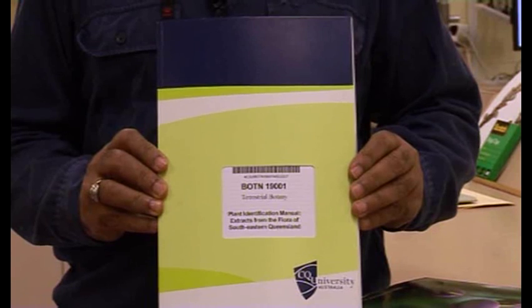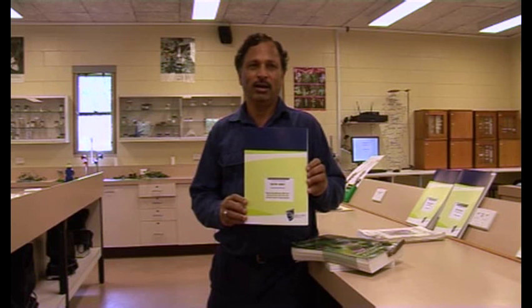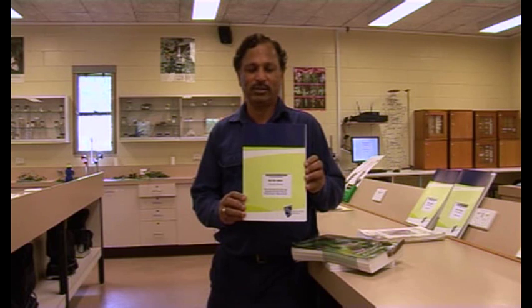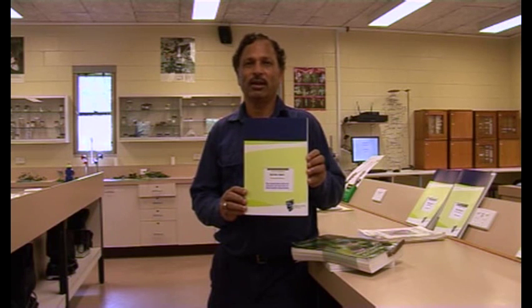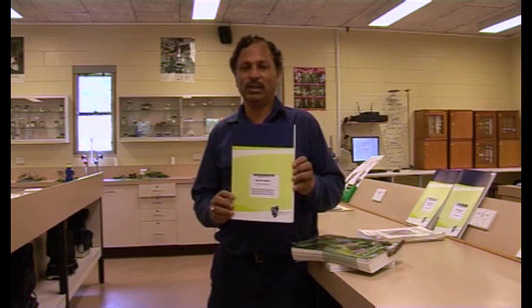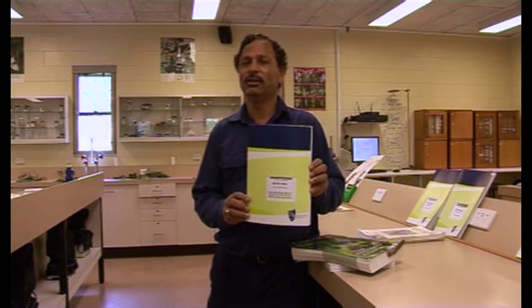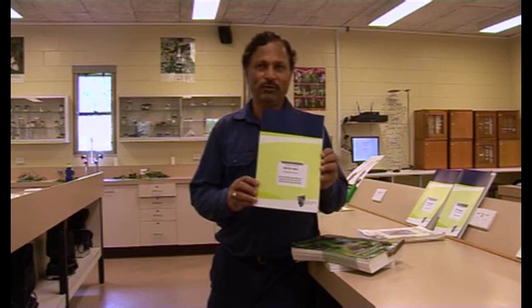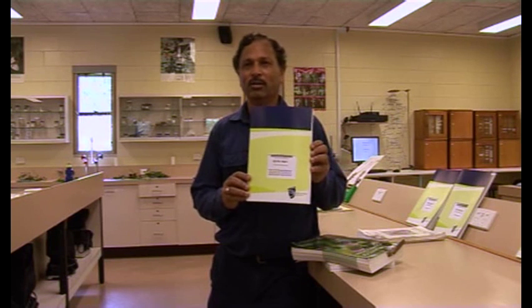Once you go to the genus level, you verify whether the specimen description really meets with all the descriptions you have characterized. For example, if the book says this has got five petals and you have counted five petals, you're right. If it says five sepals, five petals, and ten anthers, then all of them tally with what is described. Also, the photograph of the plant you have collected looks similar to the one described in the local book.